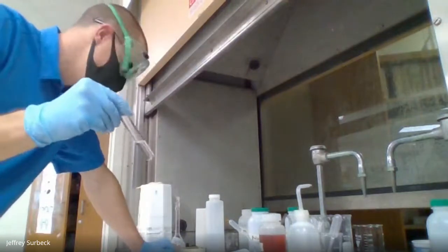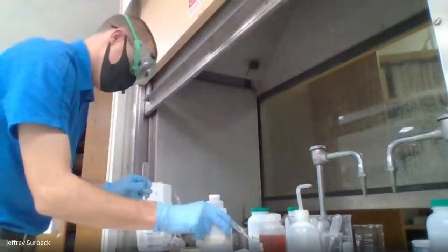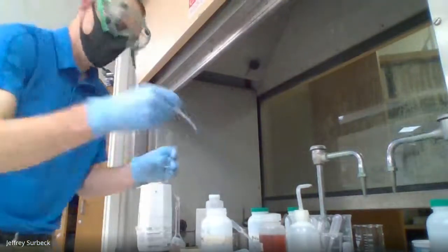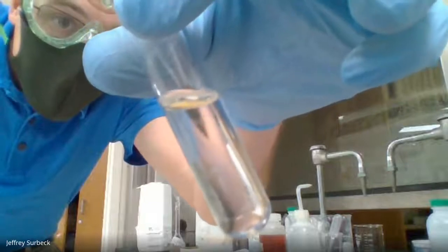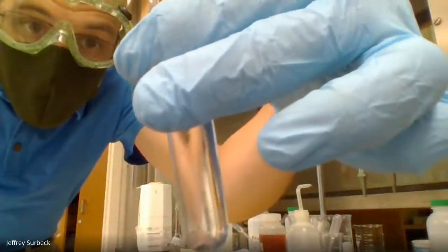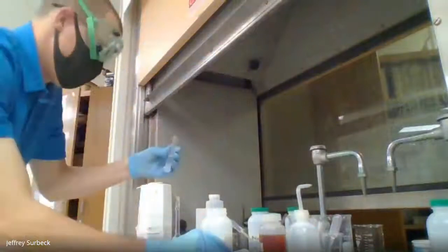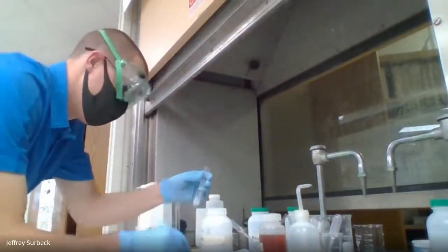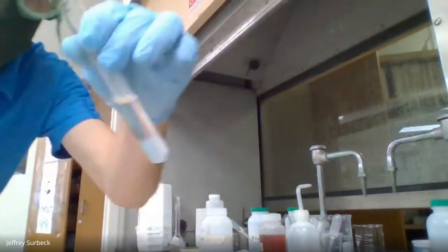Now we're going to acidify the solution again by adding our nitric acid. Okay? So we're going to add our nitric acid drop by drop until we notice a change. We get some more nitric acid here. This is starting to come about here. Let me make sure you can see it.